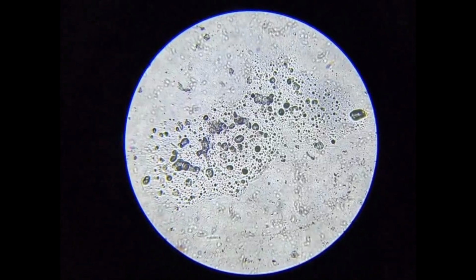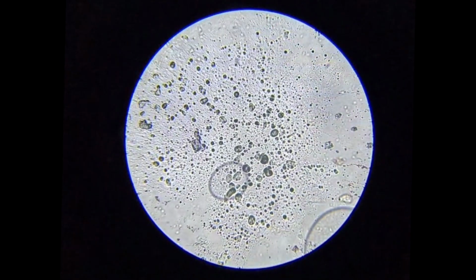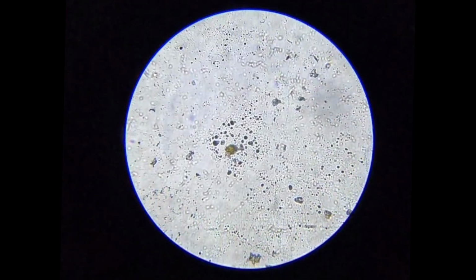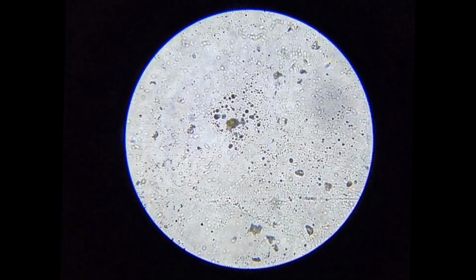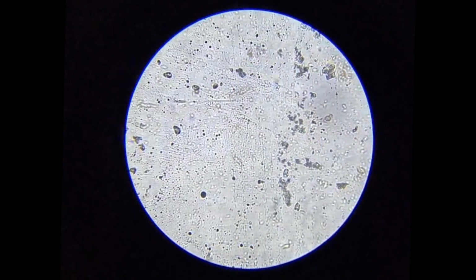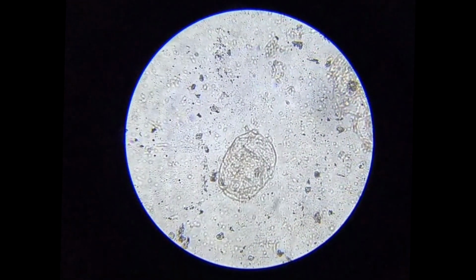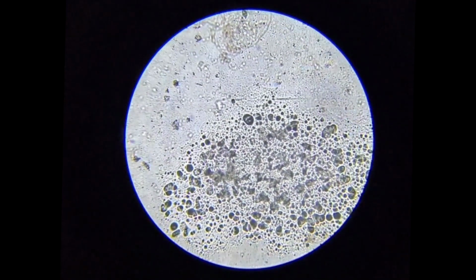Those numerous small, dark, round bodies you see are most likely chromoplasts. These are pigment-containing structures that store lycopene, the compound responsible for the red color of the tomatoes. Since tomato fruit tissue is very soft and made of loosely arranged parenchyma cells, many cells naturally release their contents when cut. As a result, instead of seeing neat rectangular plant cells, we are mostly observing suspended chromoplasts and cell sap.